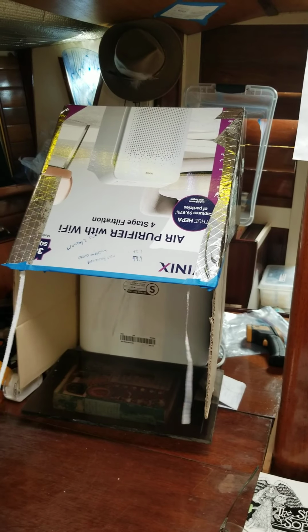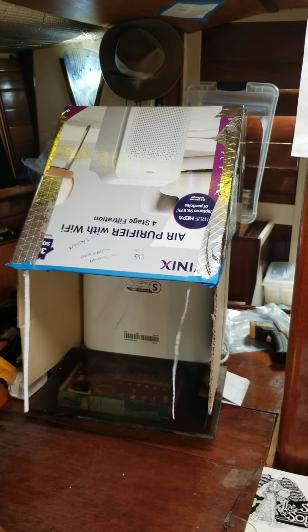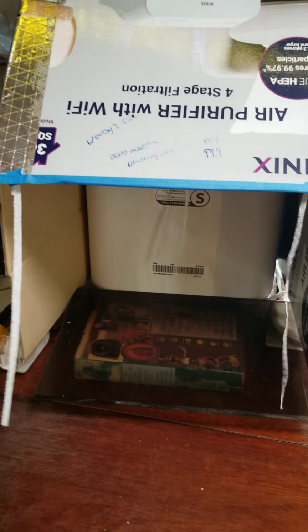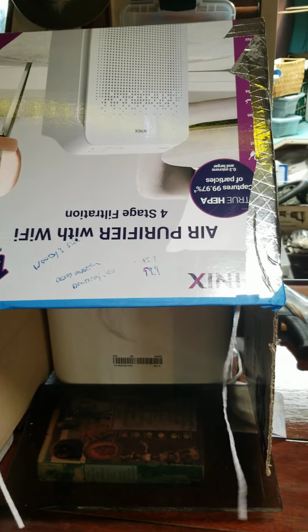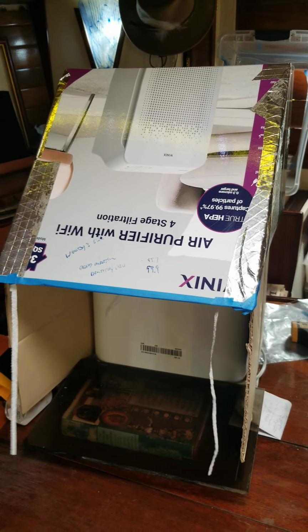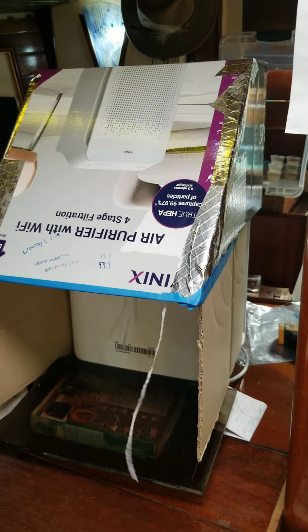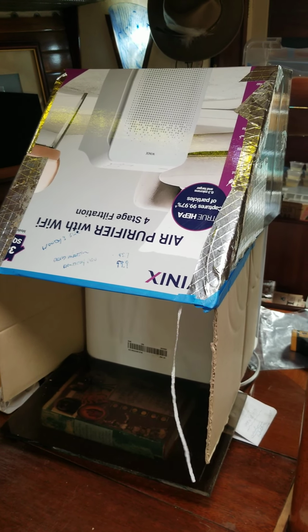And a fella has built one up with a couple of box fans and taped filters over them. He hasn't done extensive testing, and he doesn't have any enclosures, so I'm not real impressed with what he did, but the concept is there. And really, to me, this is the easiest way. You can get these little room air purifiers for, you know, something to a 200 to 400 square foot room, and then just take a cardboard box and build an air shroud to direct the air how you want it.